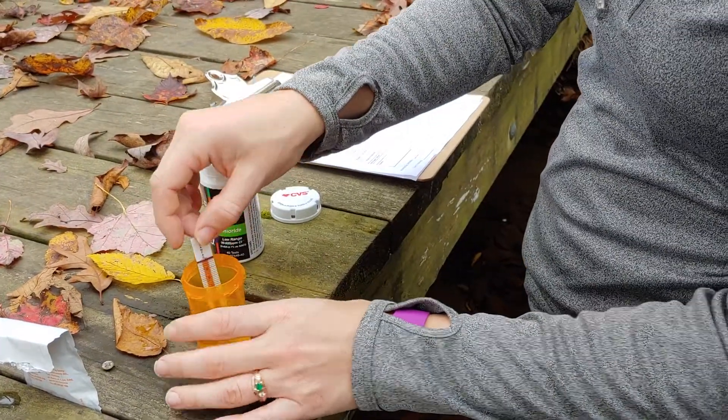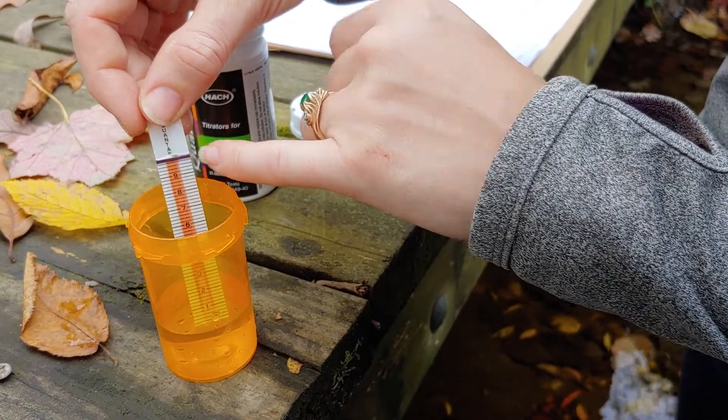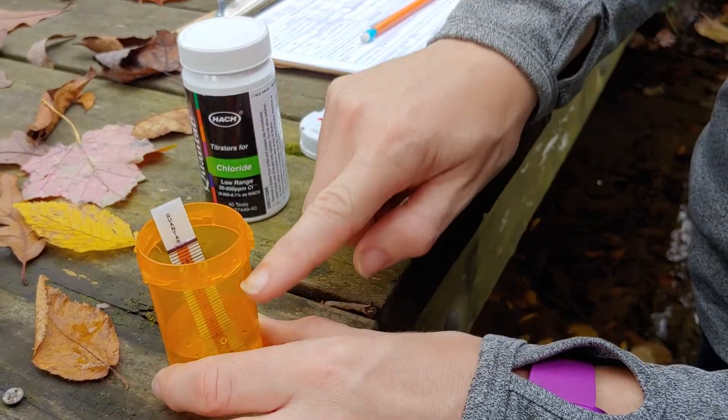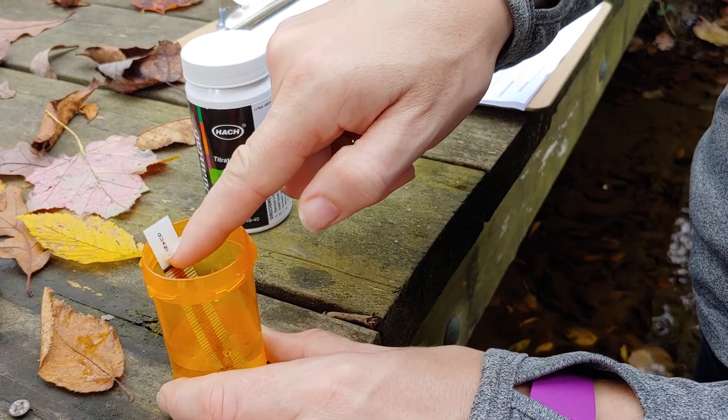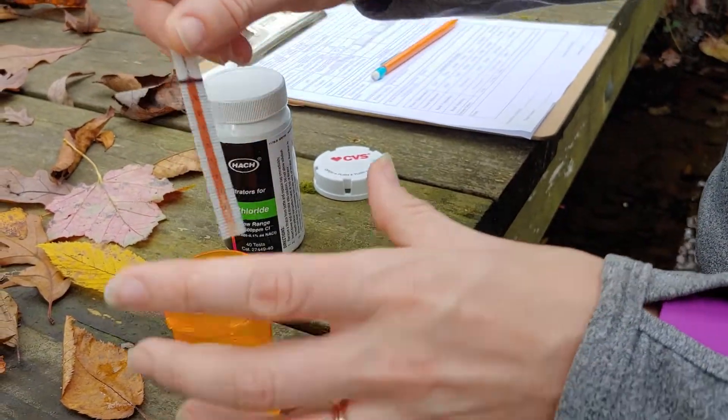Okay, so our orange strip has turned black which indicates that it is ready to go. And we were careful when we put this in that we didn't fill our container up higher than that orange line, or else it would tell us it was done before it really was.